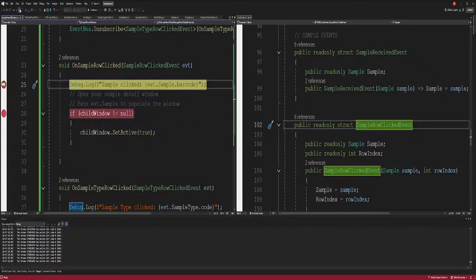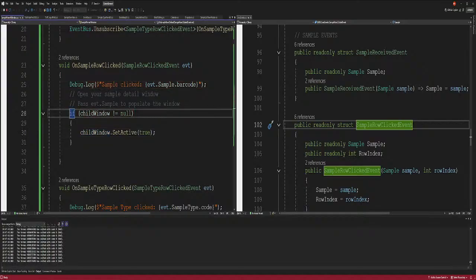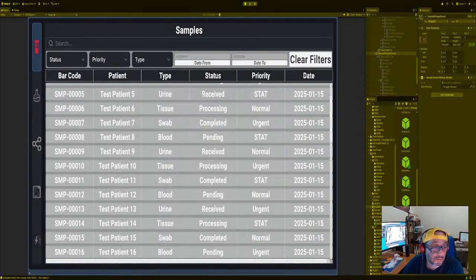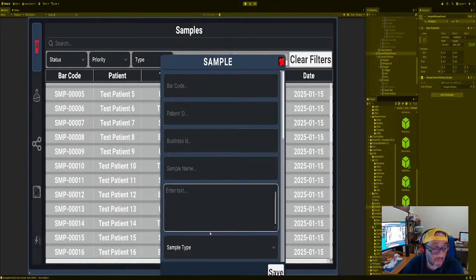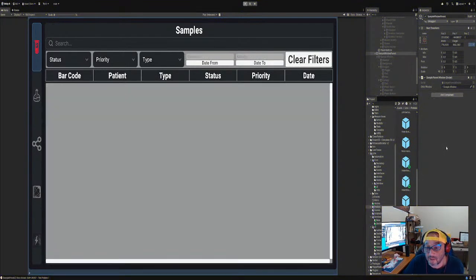So we have debug, and open the window, set the window to true, and we should get a window right here. As you can see, I'll take the stopper off and run it again. As you see, this pops up. But we want to make sure it pops up with the data. So let's try it again. Click any one of these, see, it popped up really, really quick. So on the sample window here, we have to make sure that we get the data in there.